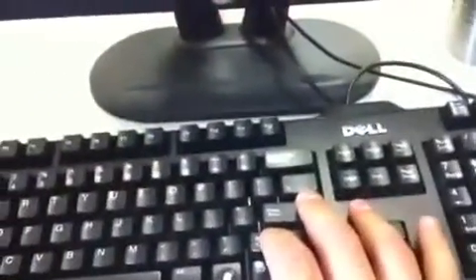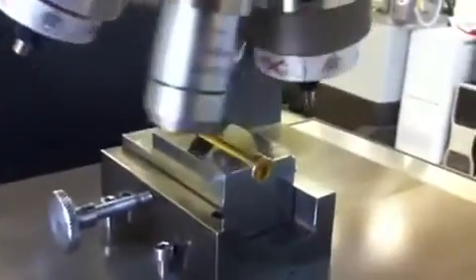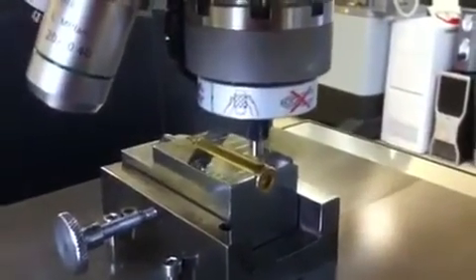We'll navigate to that point. I can press the spacebar on the keyboard and I now get a crosshair approach. The user can then just press Enter, and at this point the software has completely taken control and our tester will now make a series of indentations along the bullet shell.